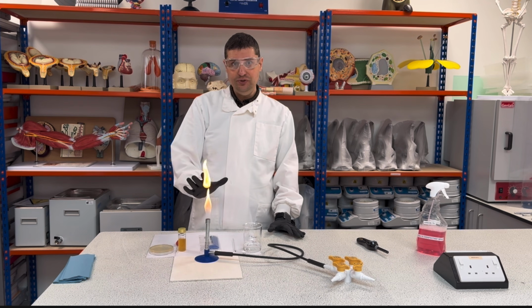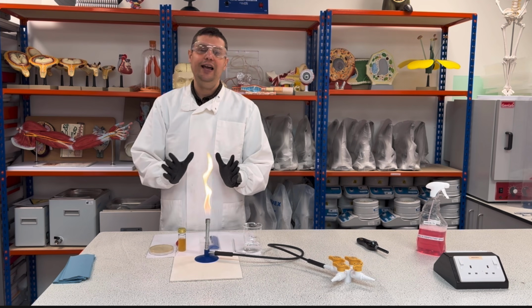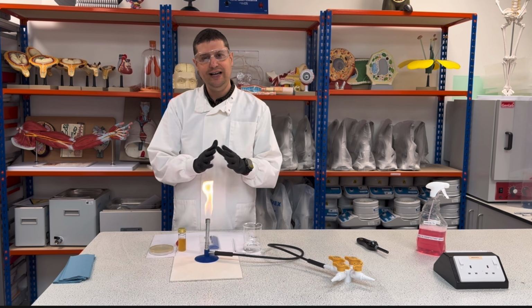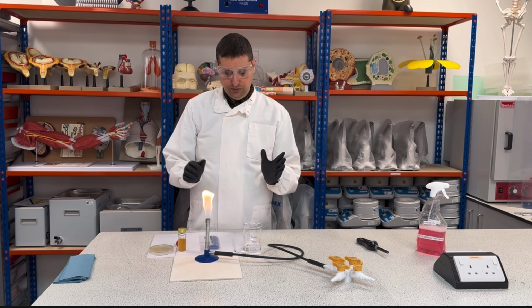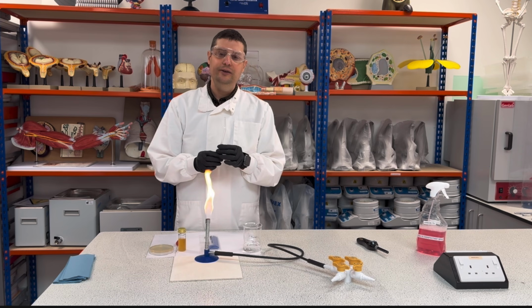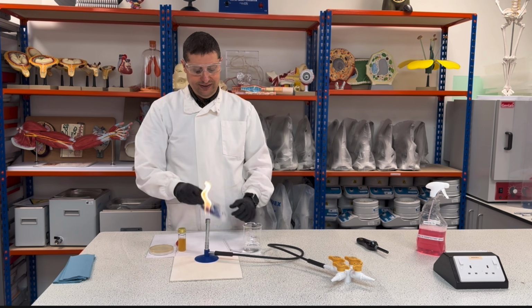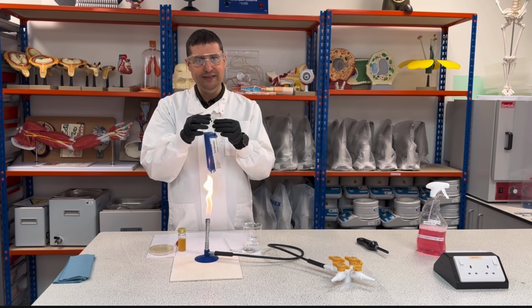For this demonstration, I will go for the most complicated part, and then the simple ones I don't need to show because it will be exactly the same procedure. The most complicated part would be using my glass spreader. Why? Because the glass spreader needs to be disinfected every time I use it. So this is sterile. This is completely sterile. Can you see the bag is sealed?